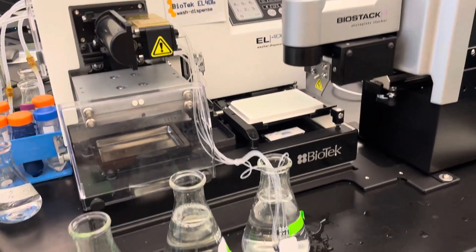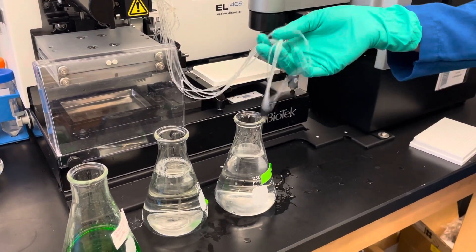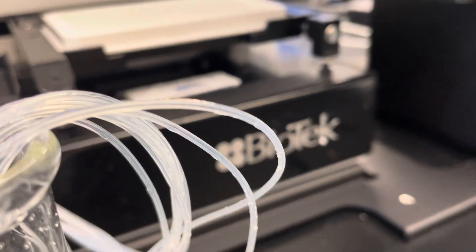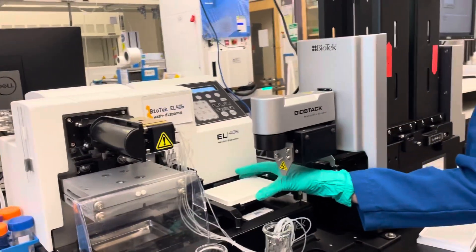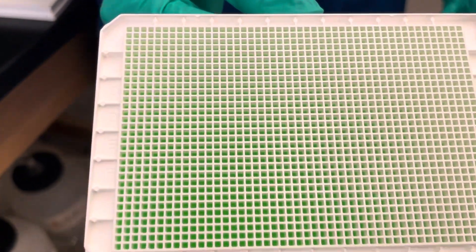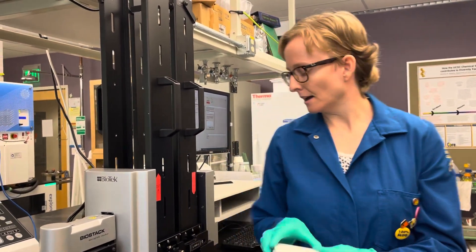Then we'll do one more water rinse. For the final step, bring it up into the air so it's actually going to be drying. All right, so this is what the dispensing looked like — lovely. That's our 1536 well plate, all dispensed.